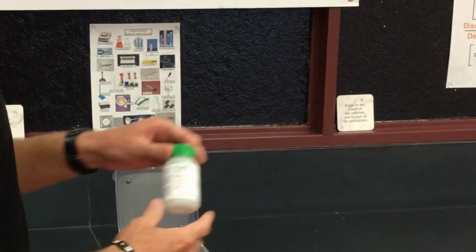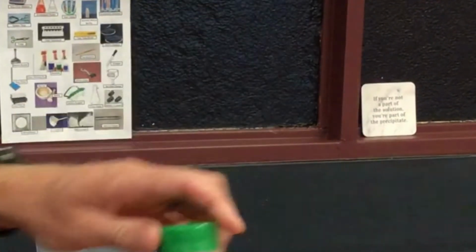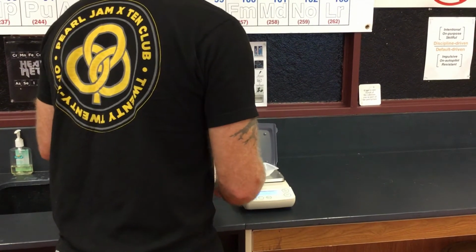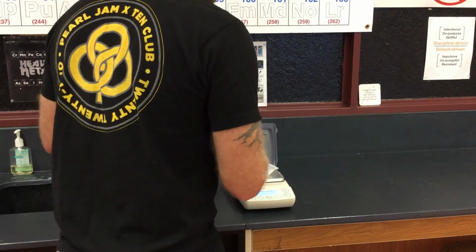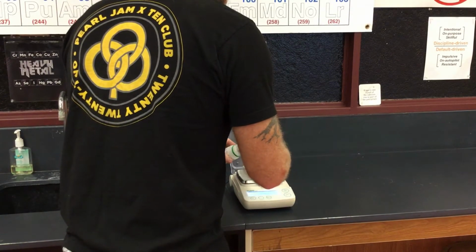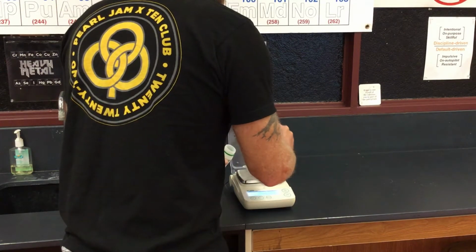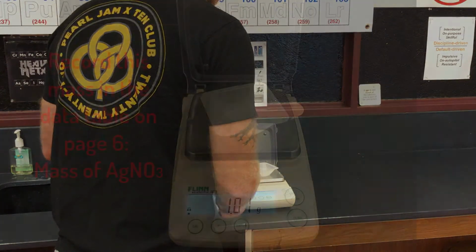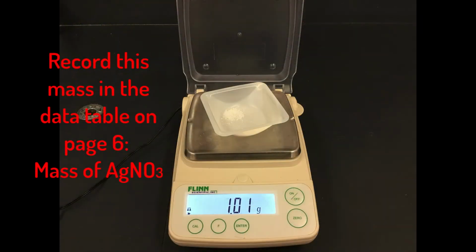Mass out about 1 gram of silver nitrate on the electronic balance that reads to the 100ths place. Record the exact mass of this silver nitrate in the data table on the top of page 6.